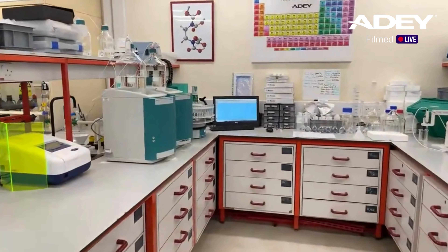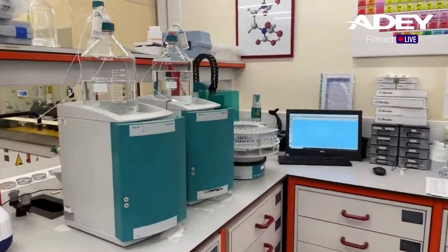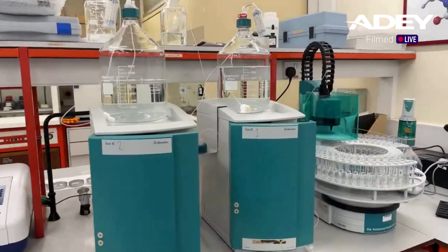We are a UKAS accredited lab for all of the other water testing here, which again ensures full traceability of water samples down to the analyst who performed it, when, and all the chemical reagents that have gone into that testing - were they in date, when were they last calibrated, when were they last checked? There's a lot that goes on behind the scenes to obtain and keep that UKAS accreditation, but it ensures the quality and reliability of the final results.